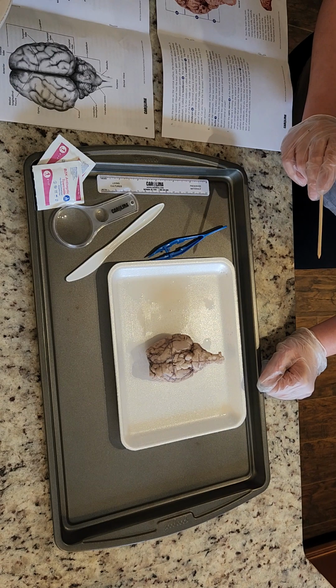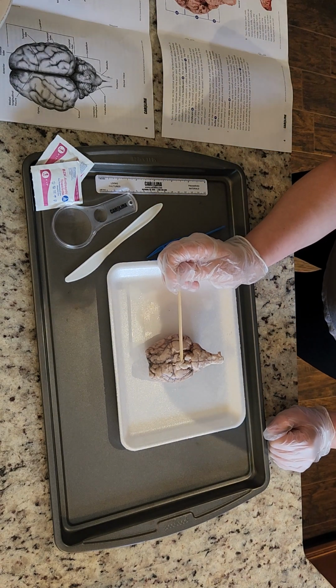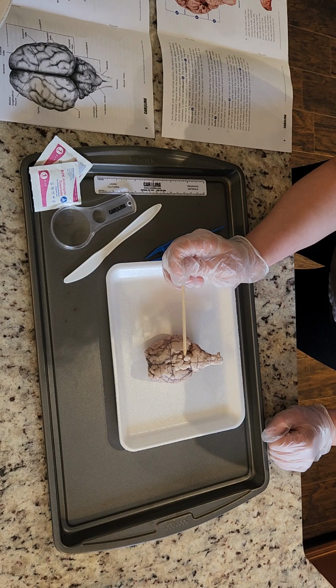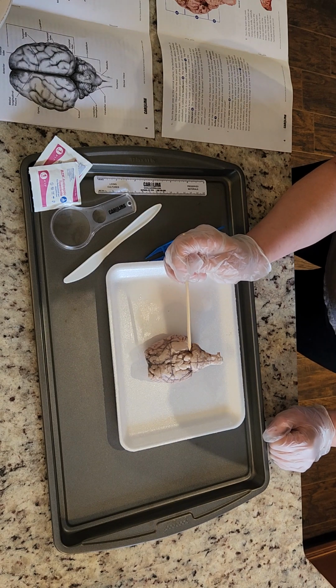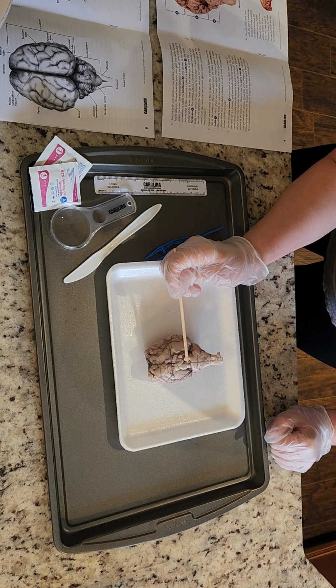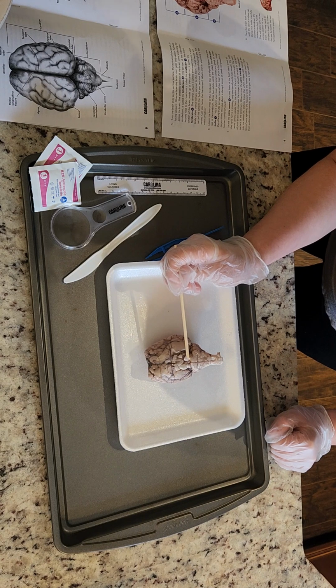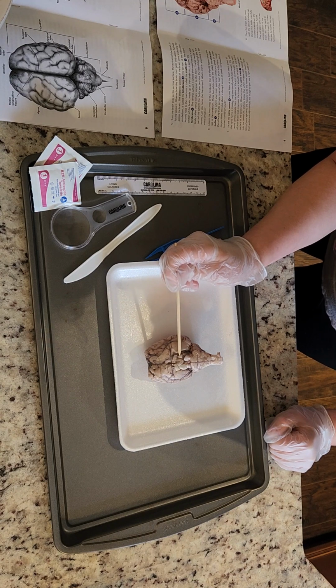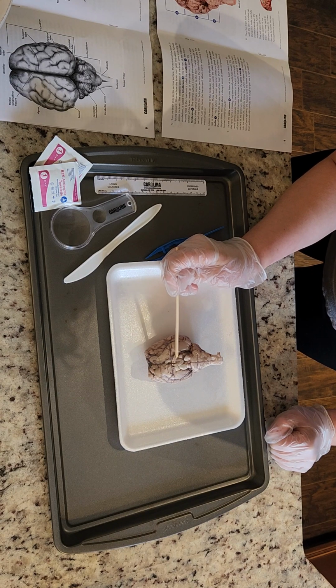And then you have the optic nerve, which is right here. It's very tiny. And then we have, excuse my dog growling, by the way. I don't know, he sees a squirrel or a bird outside, so you'll hear him every now and then. We have the optic tract, right here, maybe? It looks a little different from the picture. I'm thinking this is the optic tract, and right here is the optic nerve.